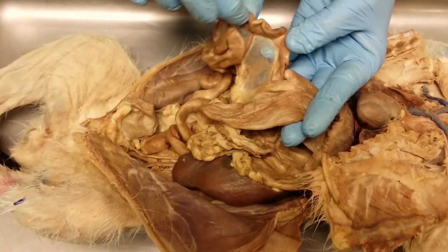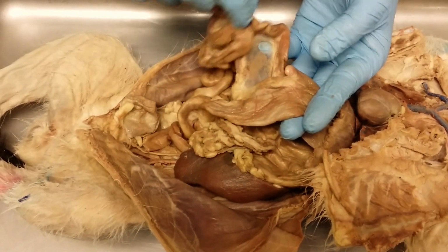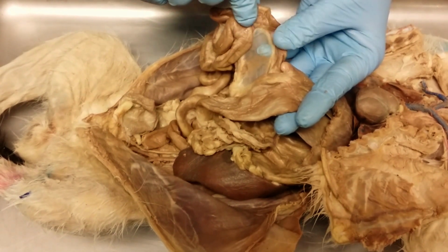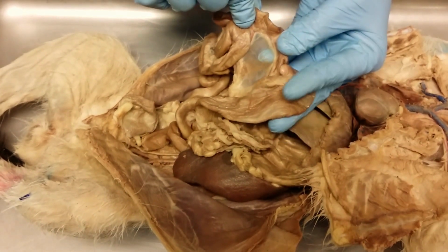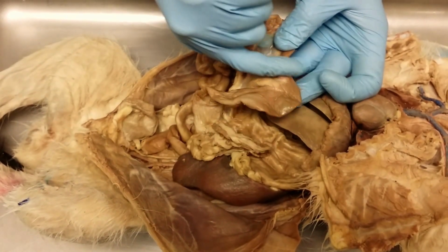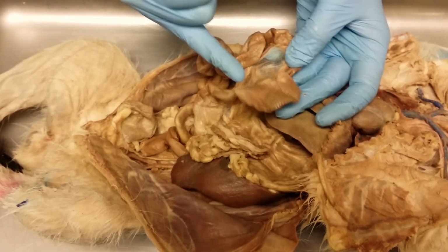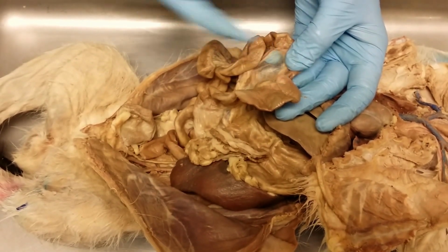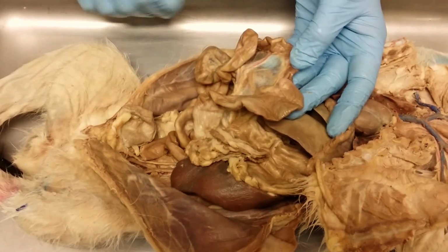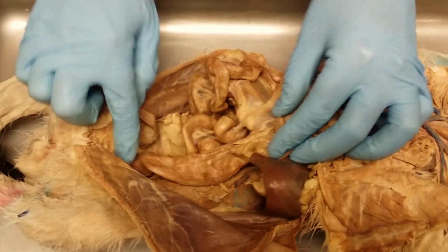Right? So if I ask the part of the small intestine that's right next to the large intestine, what part of the small intestine is this? What's the part right before the large intestine? The ileum. Ileum, okay? Right here, where the large intestine begins, this C-shaped portion, this is the cecum, okay? Embedded in here would be the ileocecal valve, which regulates the passage of chyme from the small intestine into the large intestine. In cats, here's our large intestine or our colon.